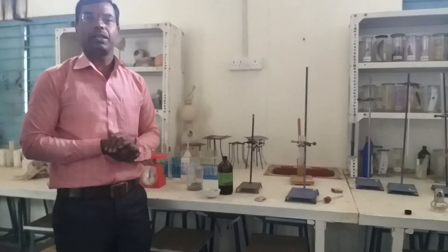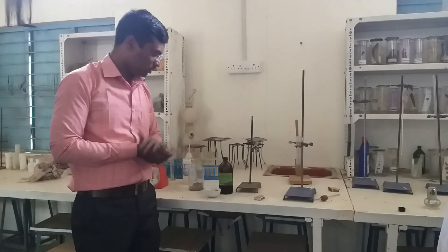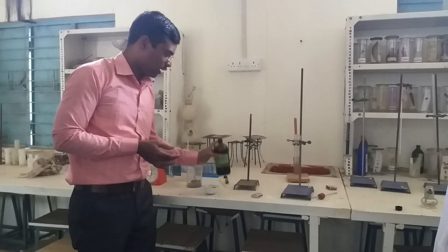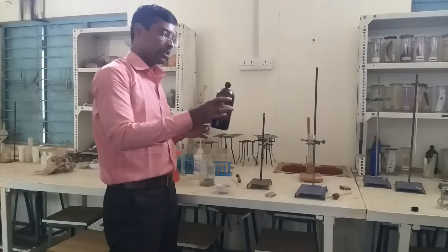Some pieces we have already added. Now add one more. And now start the reaction with the acid.